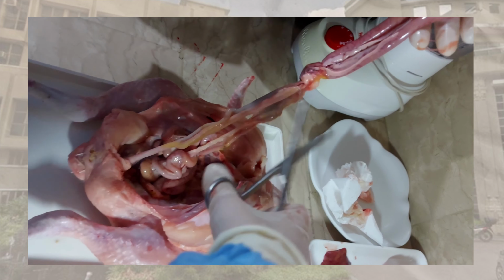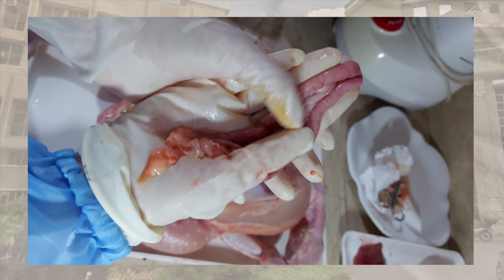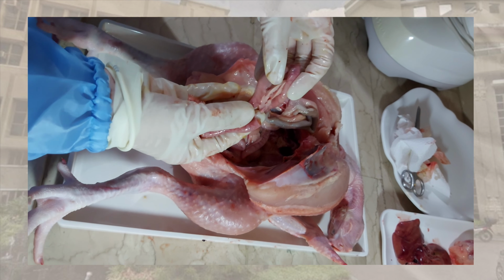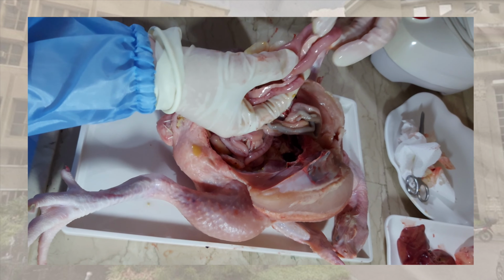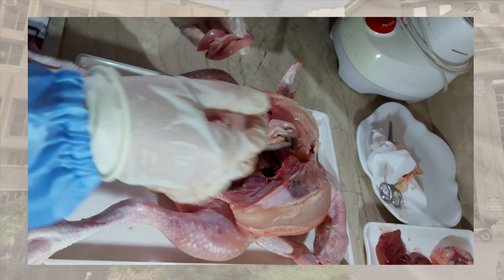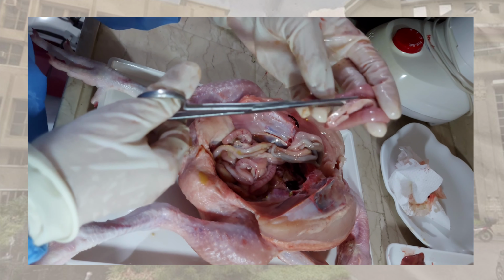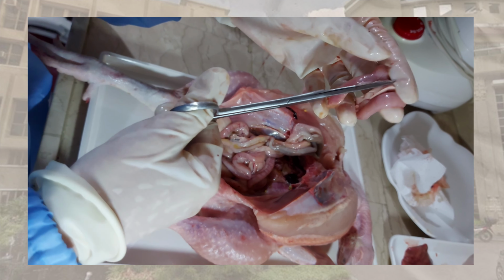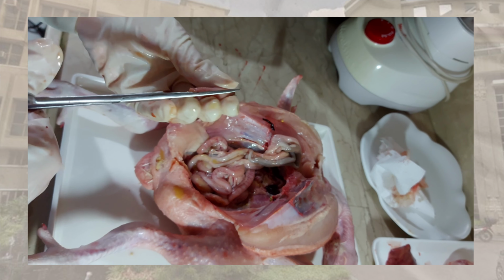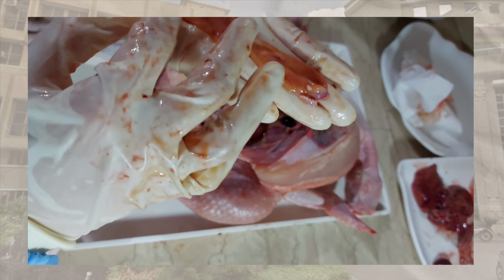After all of this, the pathologist examined the colon of the patient to clearly see the possible rupture the attending physician was talking about. A transverse cut was first performed to see the cross-section. She also made a longitudinal section cut to visualize the stretch of its walls and locate the origin of infection.